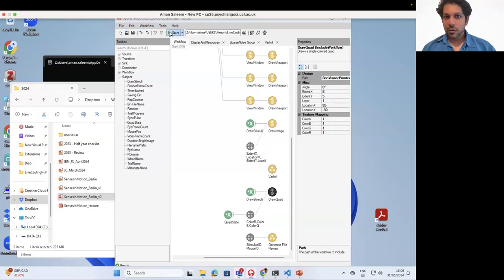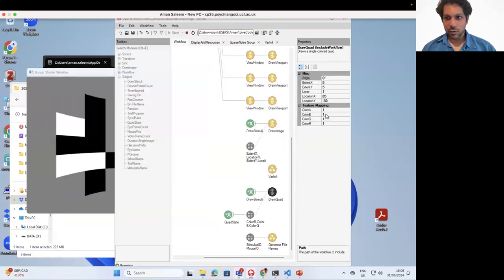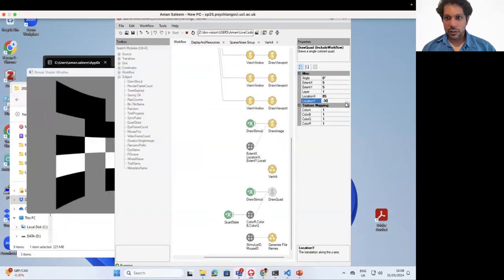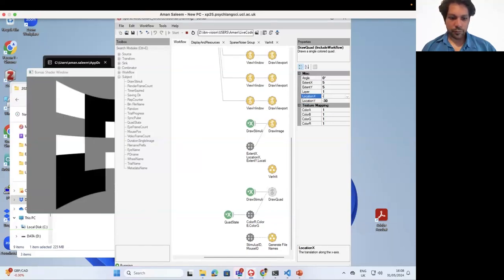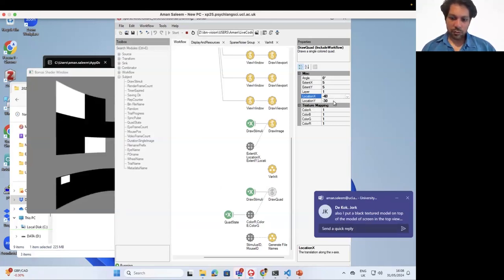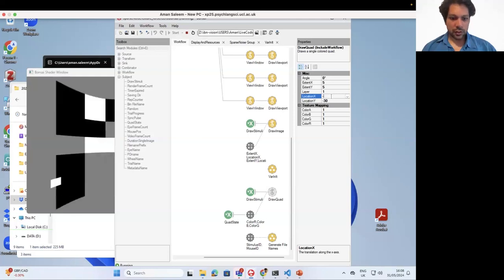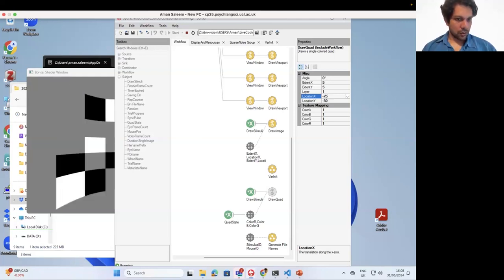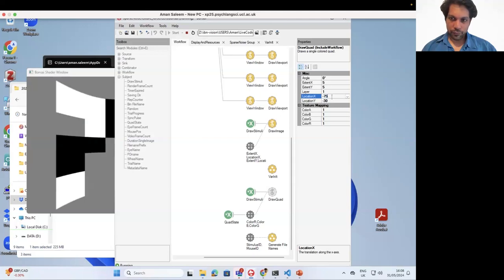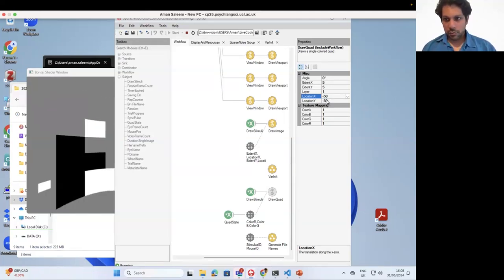Okay. So just for reference, I'm going to try and figure out this DrawQuad, which currently is at a very weird position, I think. Okay, there's the stimulus here. I'm going to move it minus 45. The reason I'm going back to this code is because it's got a slightly different strategy. I'll just put it a bit lower.